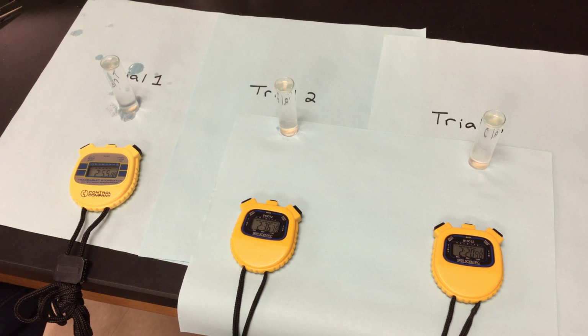And think about what's happening there with the enzyme substrate complex. So when the enzyme catalase comes up with the substrate, my hydrogen peroxide, they should be forming a product. There is no product being formed here right now, and I know that because my discs are not making their way to the top. If the enzyme and substrate were working together and producing a product, I would have water and I would have oxygen bubbles. And those oxygen bubbles would be attaching to my filter paper disc, making that disc rise to the top. But at this point, those discs are not rising.